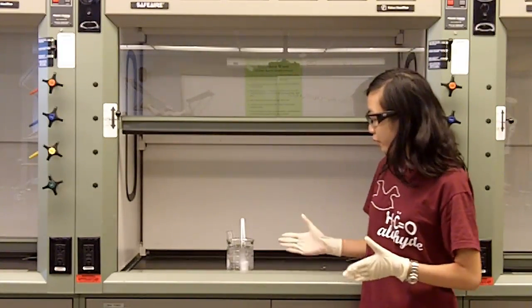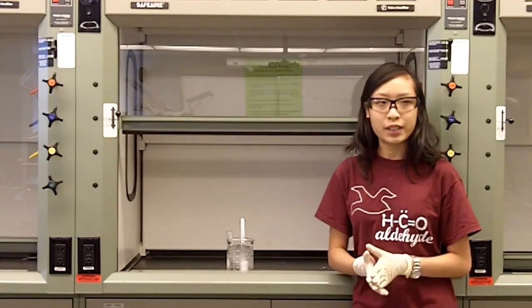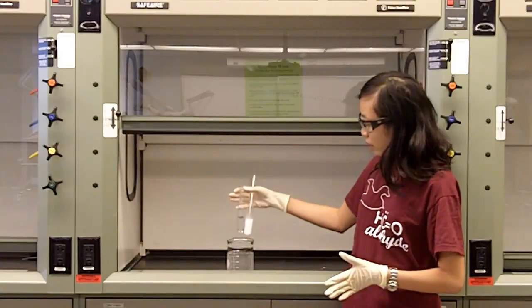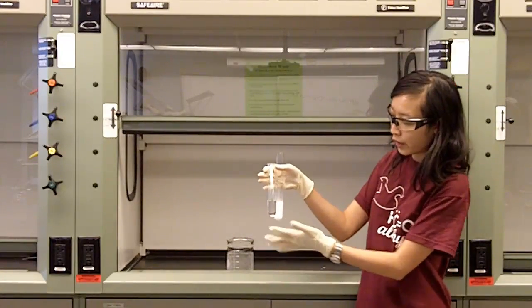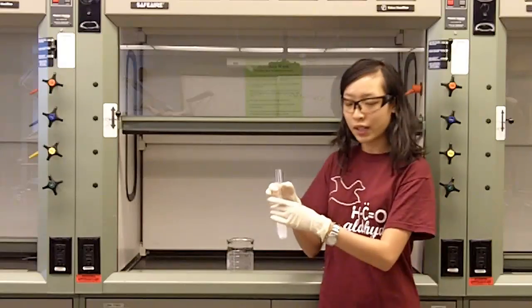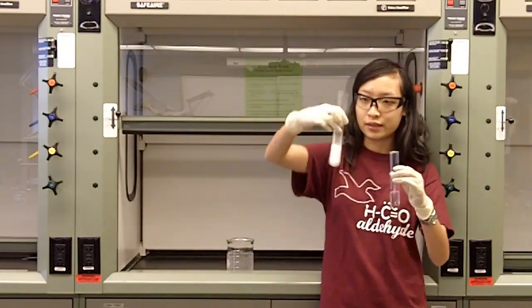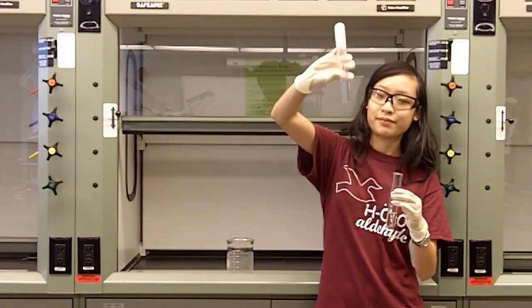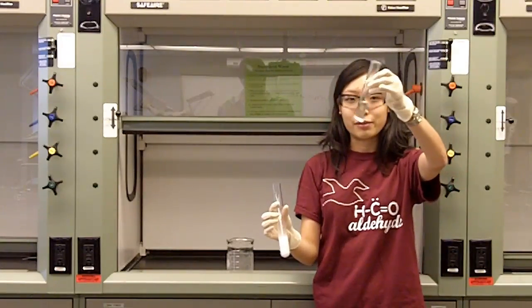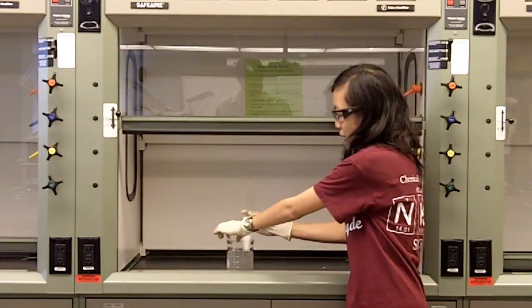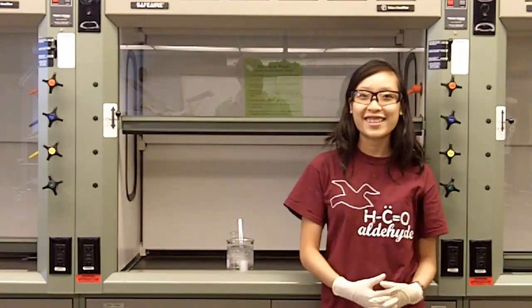We froze them in ice for about 10 minutes. Let's see what happened. This is the tube with a little water - it's still liquid. This is the pure one and now it is solid. So that's why we call it glacial acetic acid.